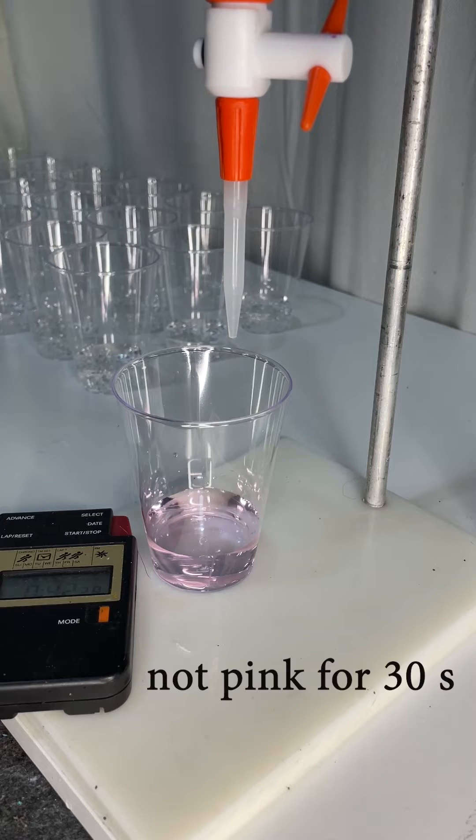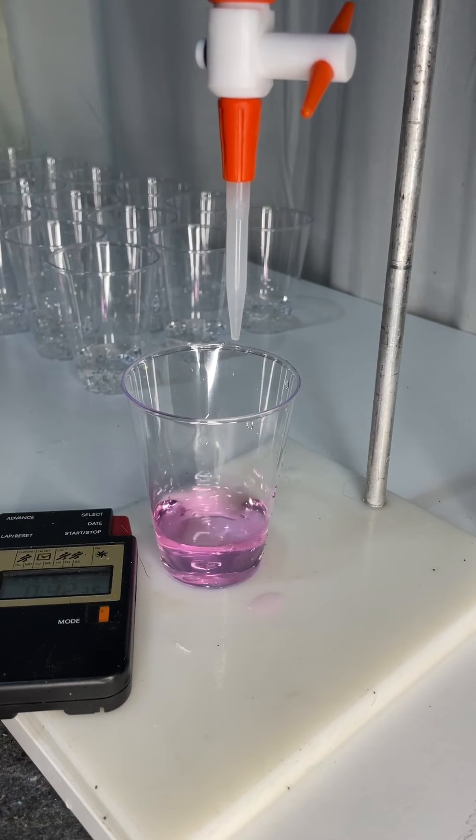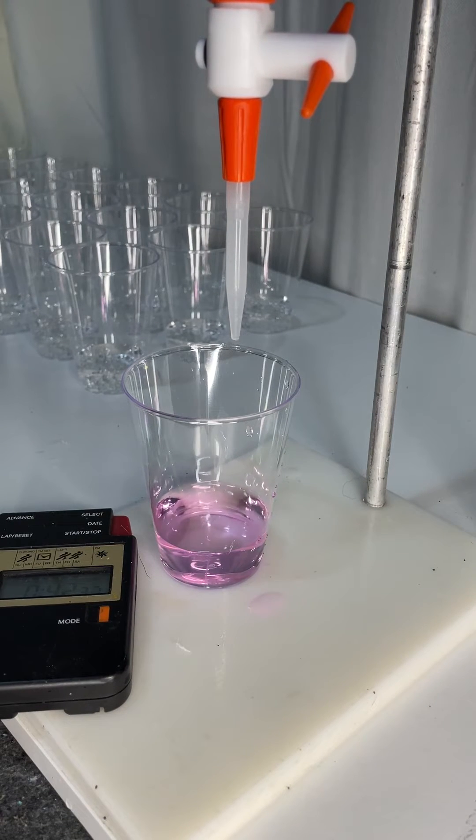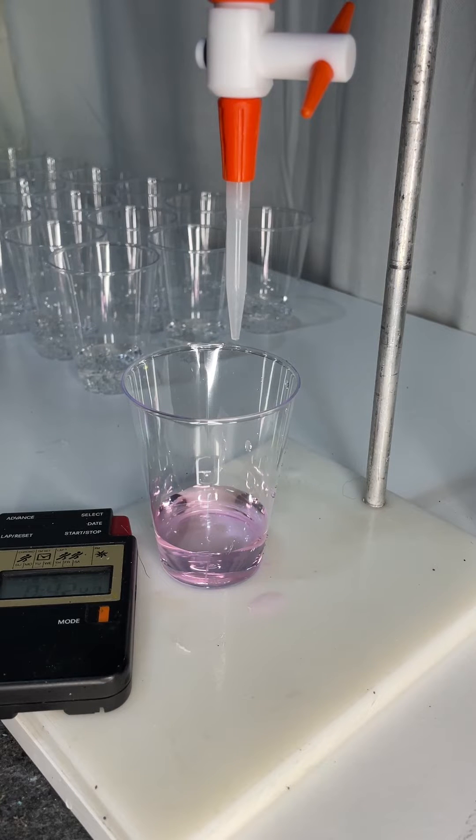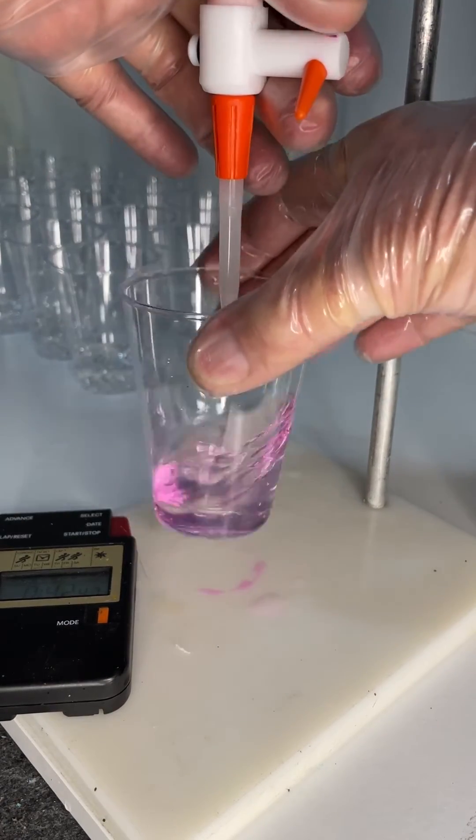We're almost there but not pink for 30 seconds. So I add a little bit more and that looks like maybe 10 seconds. It's still faintly pink but you can see it's faded to almost nothing.